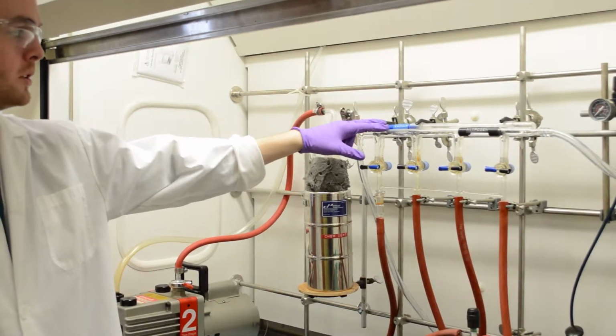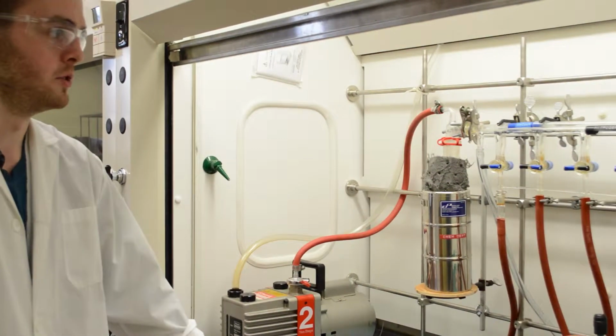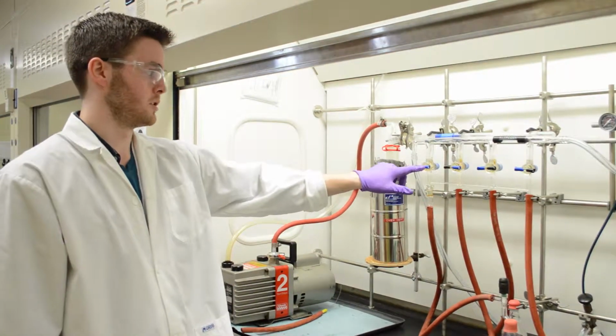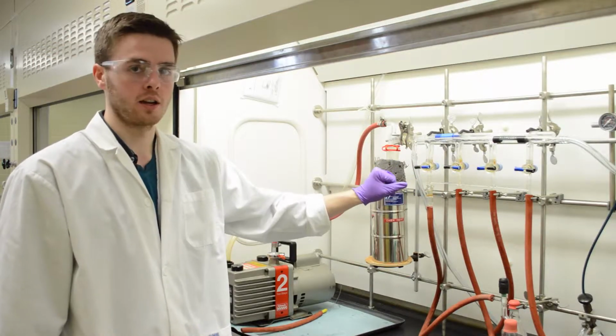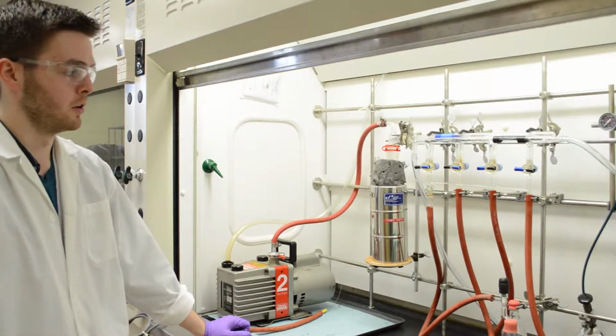This is a dual sort of pump system, and so with some you can turn on the vacuum and the nitrogen at the same time, and you don't want to do that. But with this one you can only apply one at a time, because the blue tap up here would apply the vacuum from this faucet, while the black tap would apply nitrogen separately. And so we're going to give this a second to run to make sure there is no air left in the system.